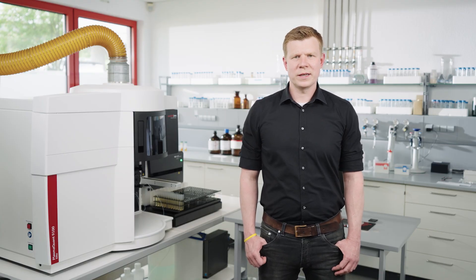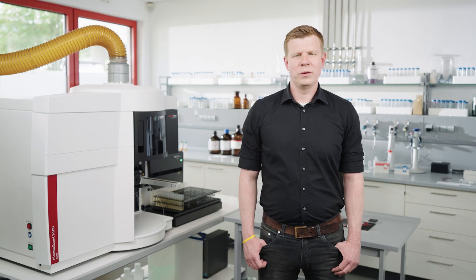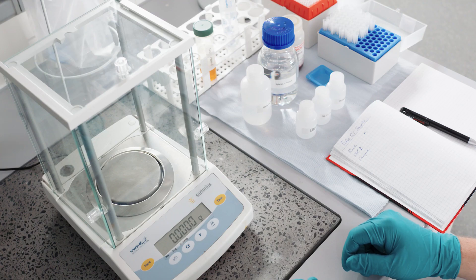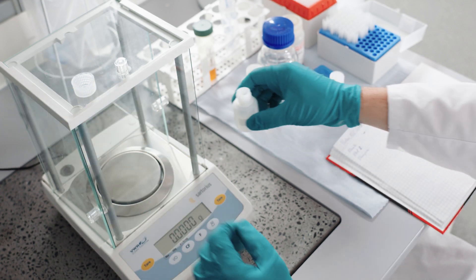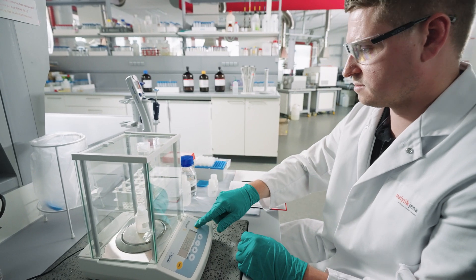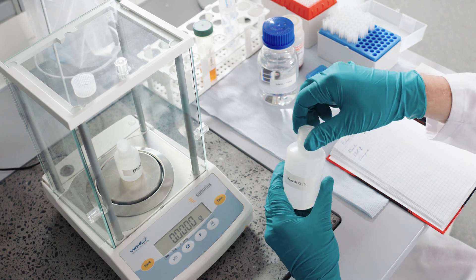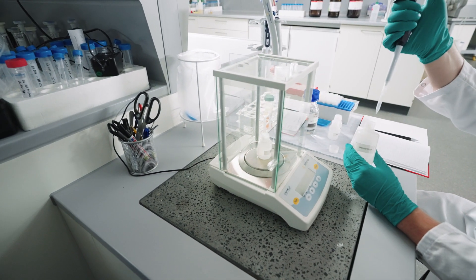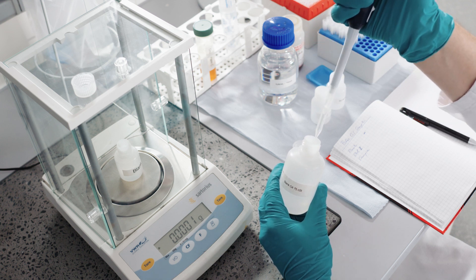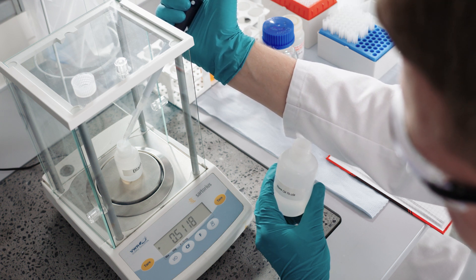For the accurate production of calibration standards and sample dilutions, we do not work in a volume dilution. Due to the differences in viscosities, a volume to volume dilution is not accurate enough. Therefore, we recommend to perform the dilutions by weight, since this provides the required precision. The preparation of the blank solution and the calibration standards depends on the magnitude of dilution as well as the viscosity of the sample material. In this example, we assume a 1 to 10 dilution. For optimal matrix matching, we use a blank oil that matches the viscosity of the sample material as closely as possible. For a high viscosity oil sample, we work with a 75 centistokes blank oil. For lower viscosity samples, we use a 20 centistokes blank oil. For the correct preparation of blanks and calibration standards, it is important to use the exact right amount of blank oil in the final measurement solution.